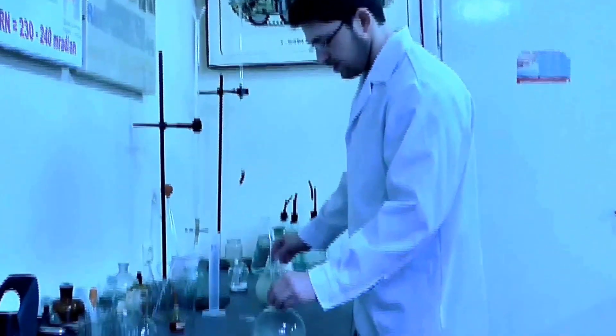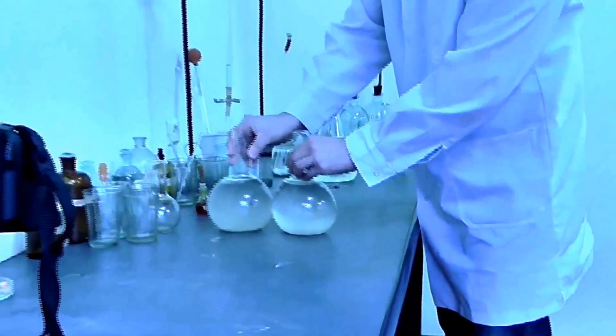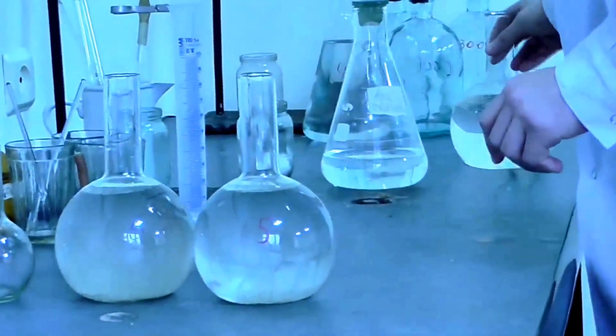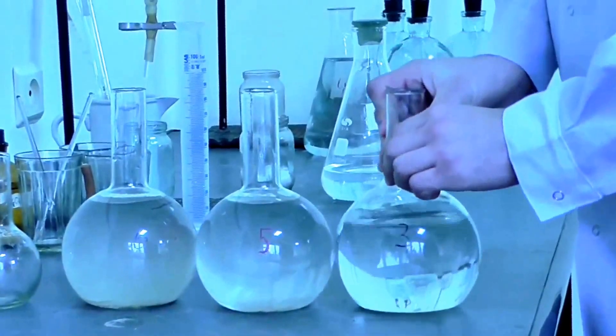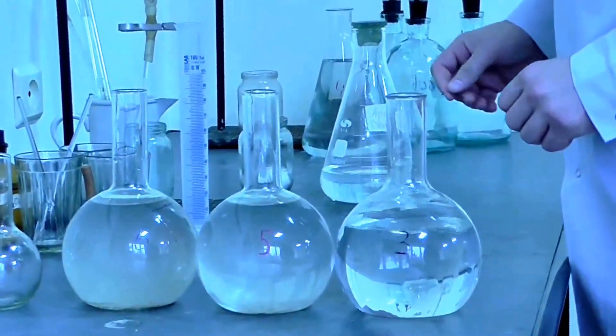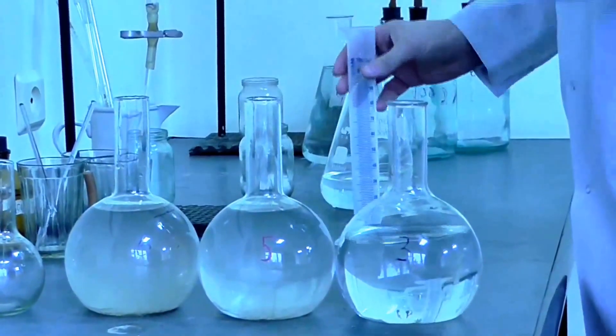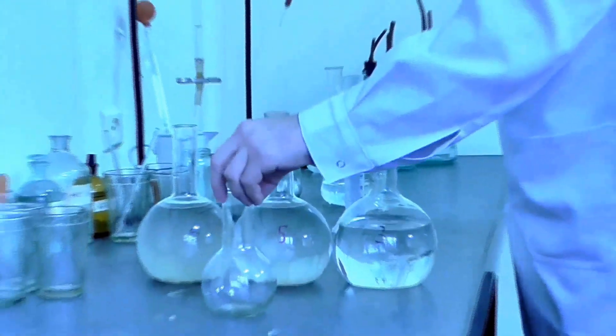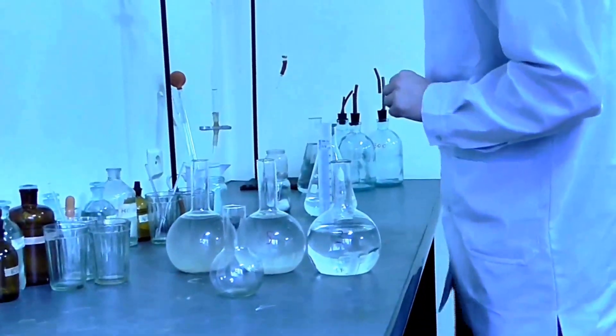Here we have three types of water. Obviously this is cleaner, this is dirtier. In this procedure, first we will fill this balloon with 100 milliliters of water.